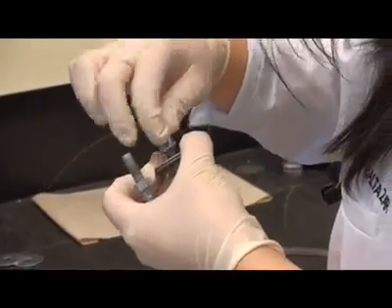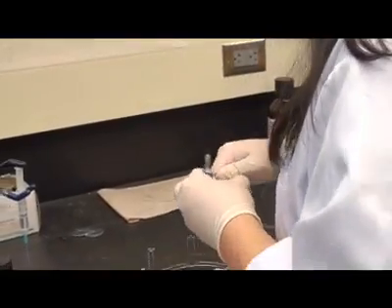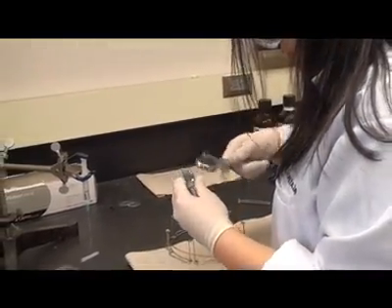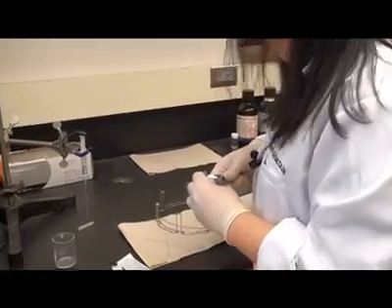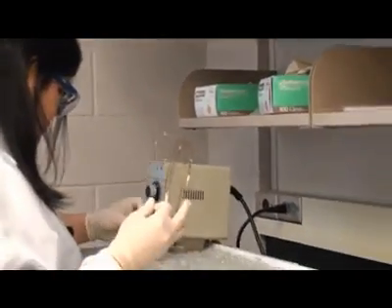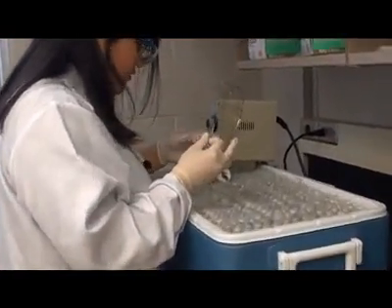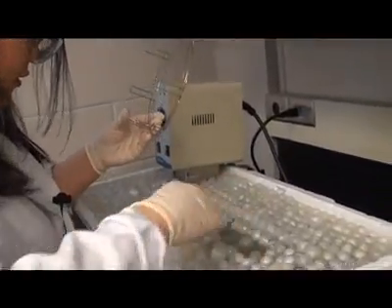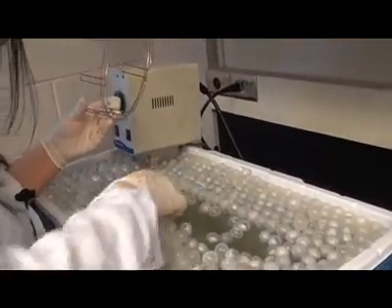So once you find a spot and you can stabilize it, then you can close it and seal it. Now that the column has been sealed, we can place it into the water bath. You want to be sure that neither end of the column touches the water or the column can be destroyed.